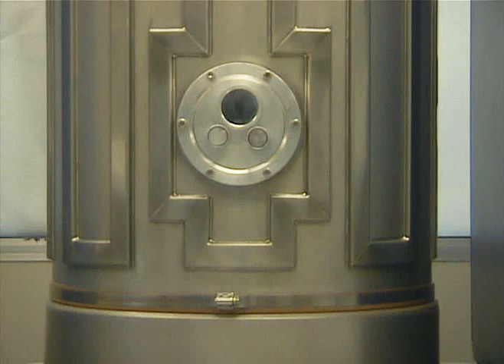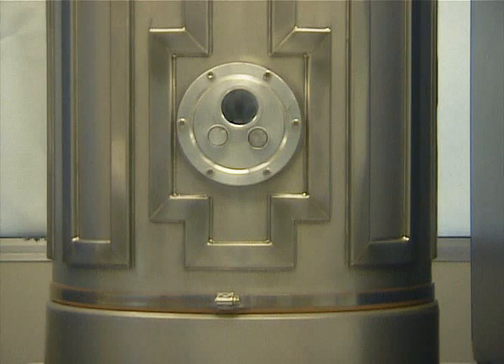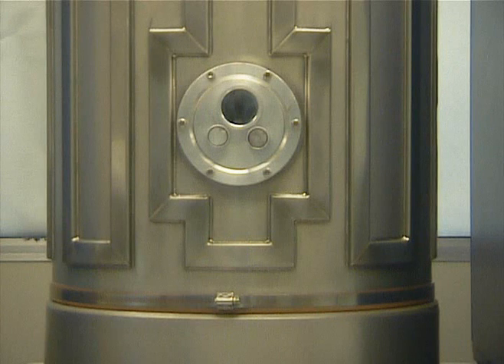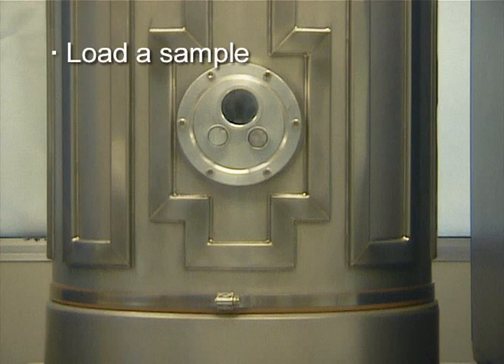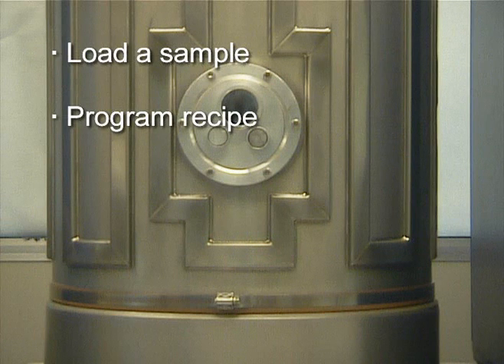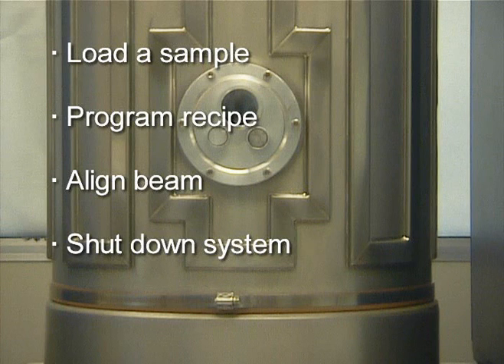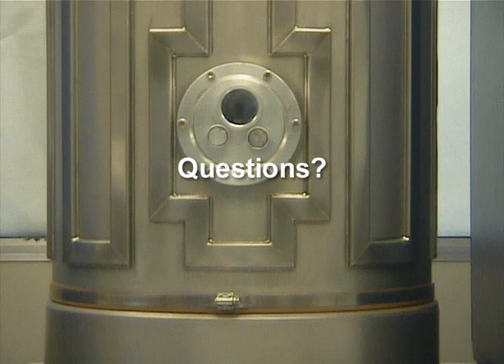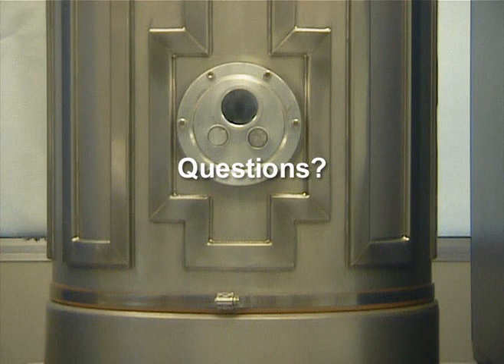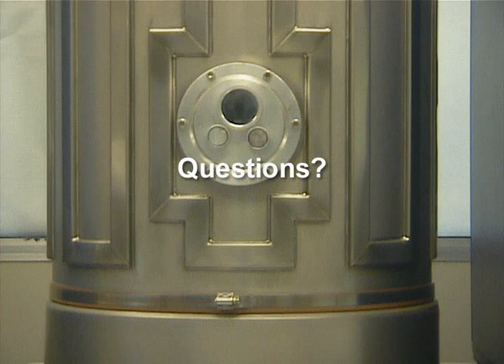After watching this training video, you should have a good understanding of how to use the electron beam evaporator. You should be familiar with the proper steps needed to load a sample, program a recipe, align your beam, and shut down the system. If you have any further questions, please direct them to the trainer for this equipment. Please do not direct your questions to Charlie Turgeon.